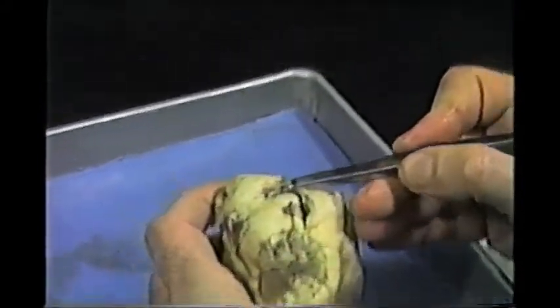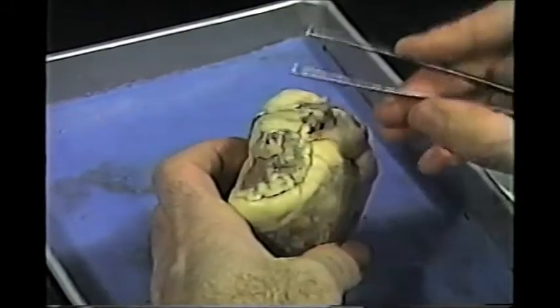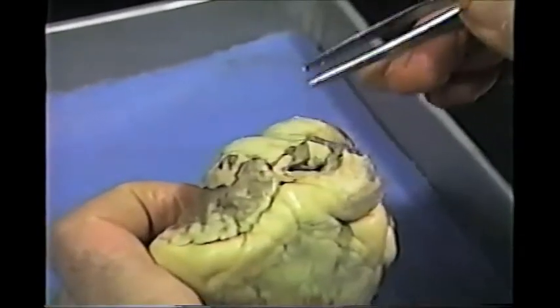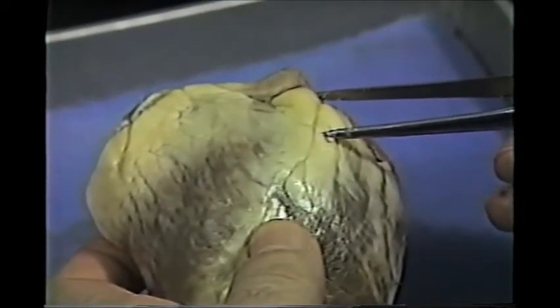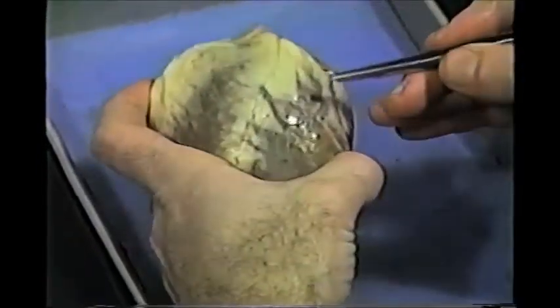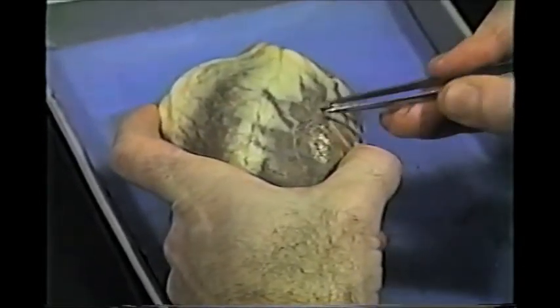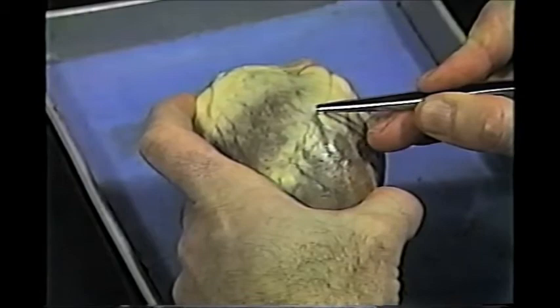The major vessels have been cut kind of close at the slaughterhouse, unfortunately, but we can still see some of them. This is probably the aorta — this vessel right here, this big opening — and some of the other major vessels, which we'll talk about later. There is a certain amount of fat around the heart; this is a normal amount. The fat outside the heart cushions the heart as it fills with blood and then contracts, so this fat does not endanger the heart. It's the fat that accumulates in the coronary arteries — the arteries that bring blood to the heart muscle — that we don't want, because that fat inside these vessels can plug up the blood flow and the heart muscle could die.